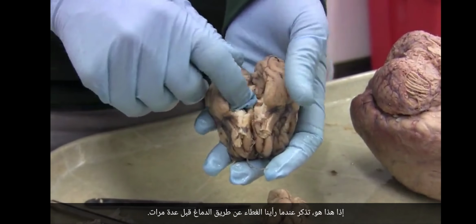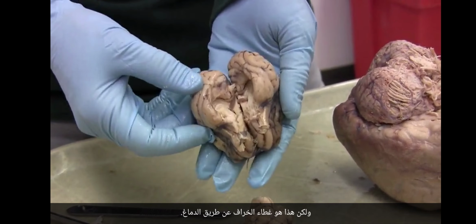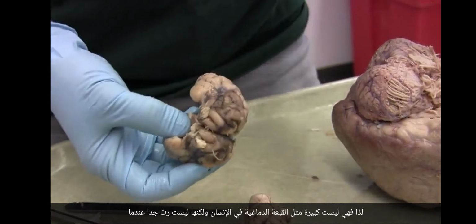Okay. So this is, remember we saw the telencephalic cap a few times ago? I'll figure out what that video is called, but this is the sheep's telencephalic cap. So it's not as big as a telencephalic cap in a human, but it's none too shabby when you consider that this is the whole brain. That's the telencephalic cap. And what do we have? We have this, which is the diencephalon. This is all diencephalon.